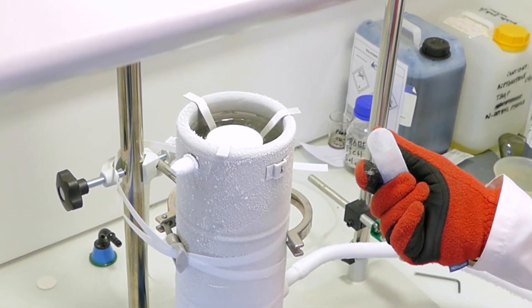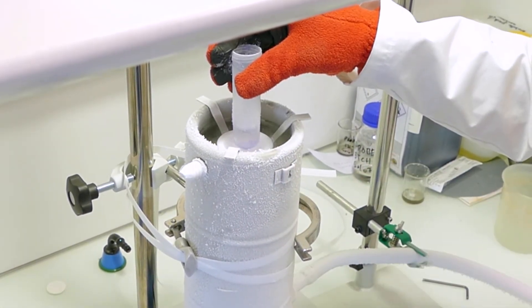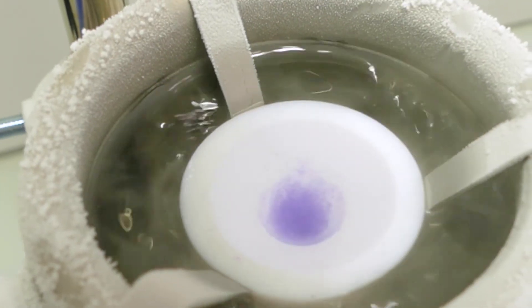Transfer the collected sample in the packing funnel under a fume hood. Make sure the sample never warms up.